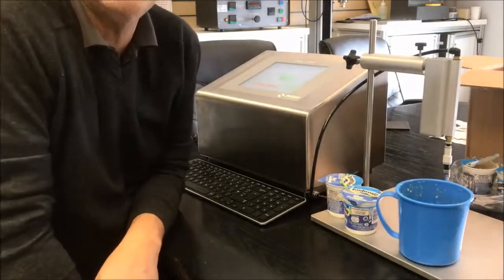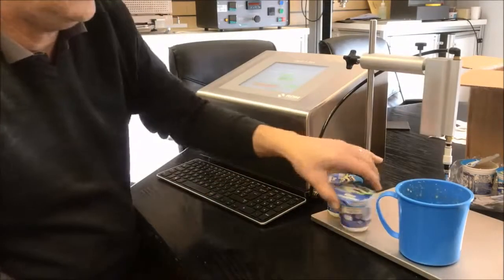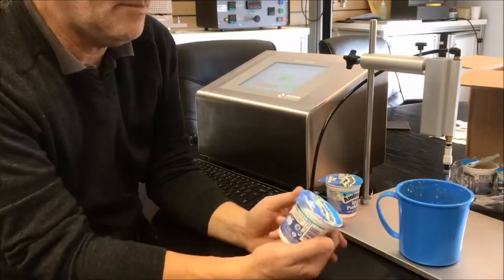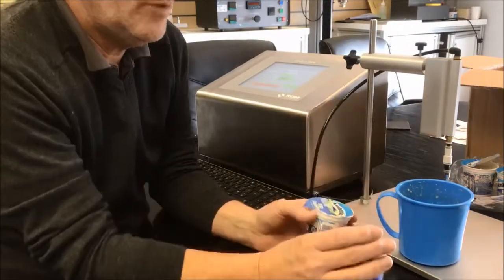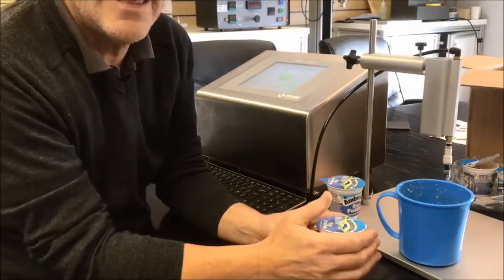Hi, I'm Phil from RDM Test Equipment. We're just here today with a couple of typical food pots to have a look at the seal integrity of these.